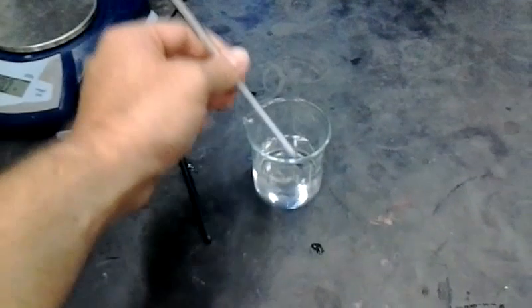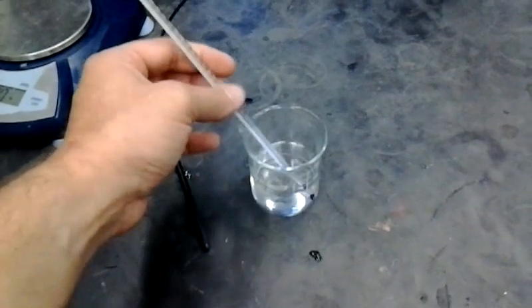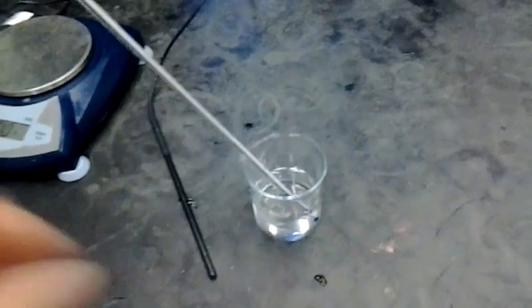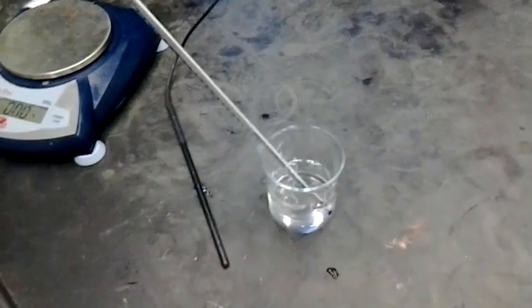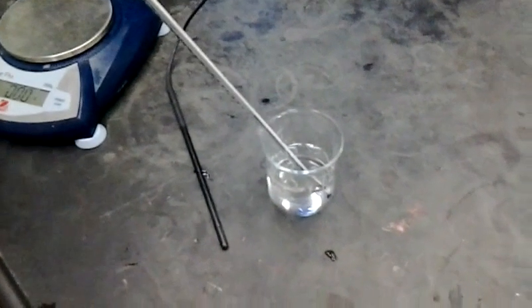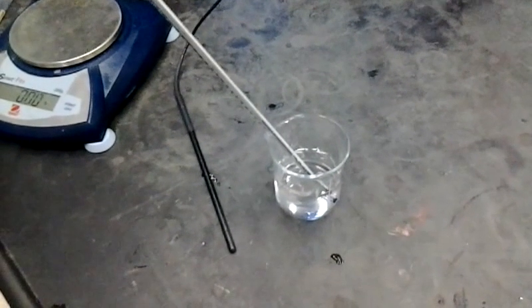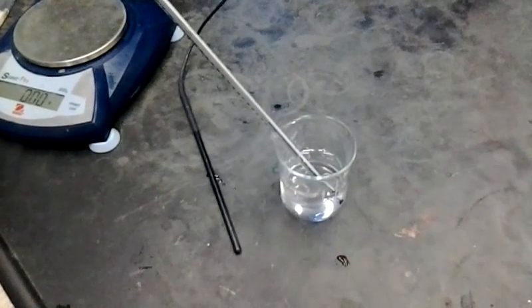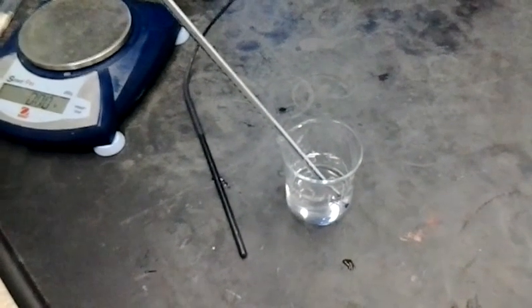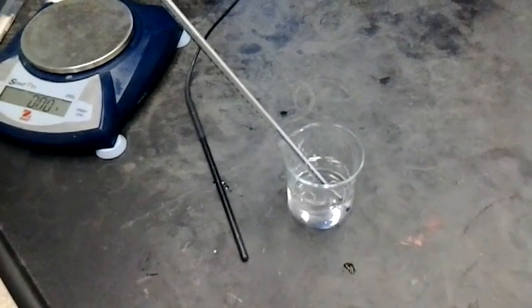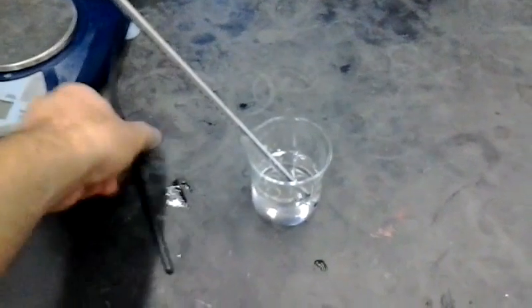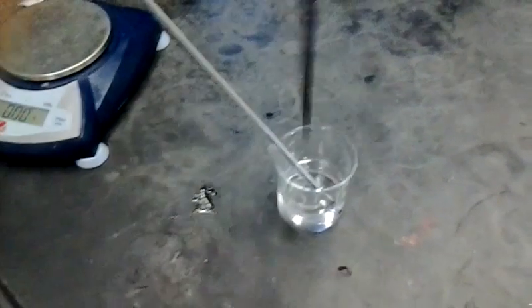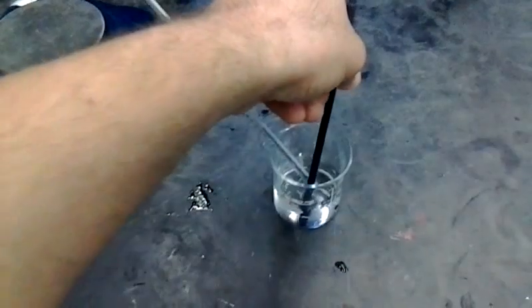You need to place the thermometer into the beaker and let it sit there for about two or three minutes so that you know that the temperature being recorded by the water is correct. Also place your temperature probe into the water as well.